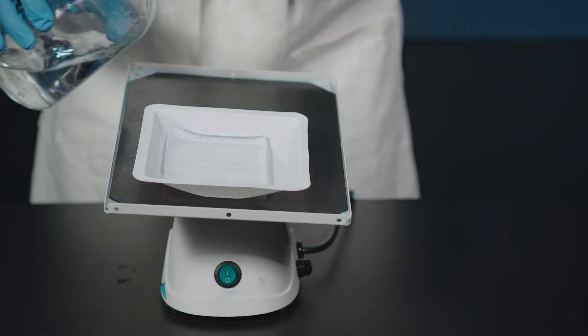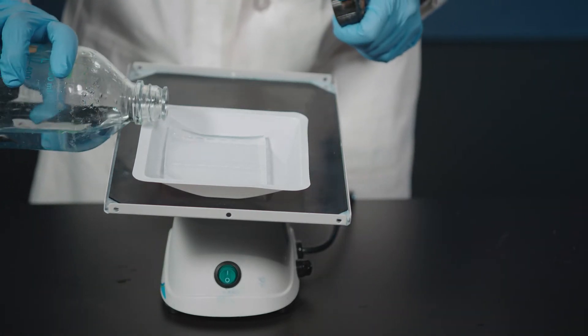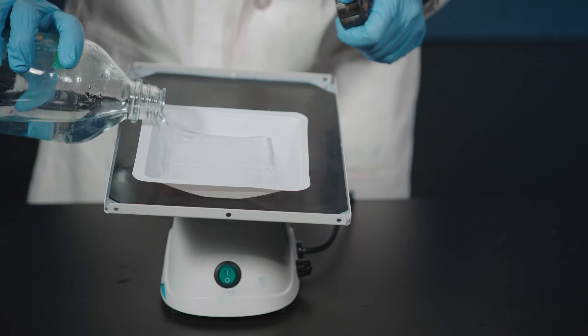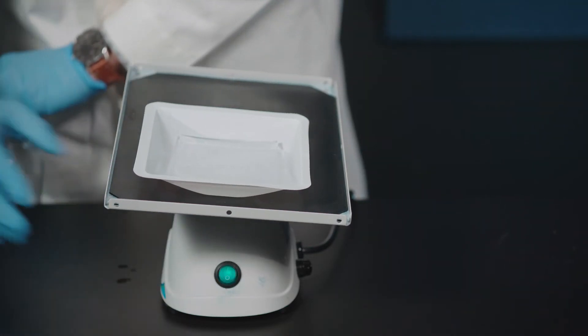return the gel onto the rocker and wash with deionized or distilled water until bands appear on the gel. This may take several washes.